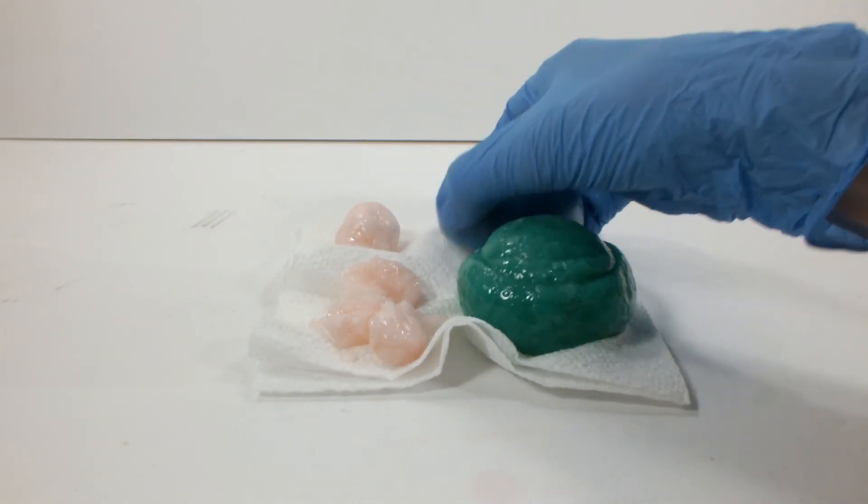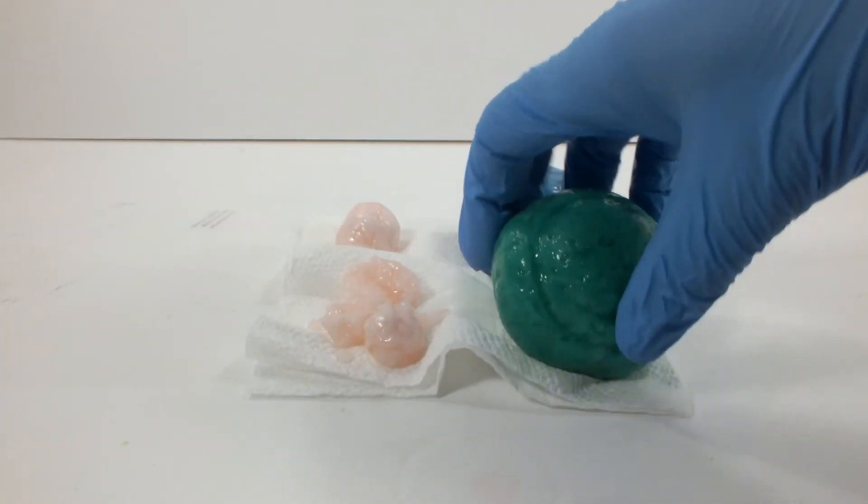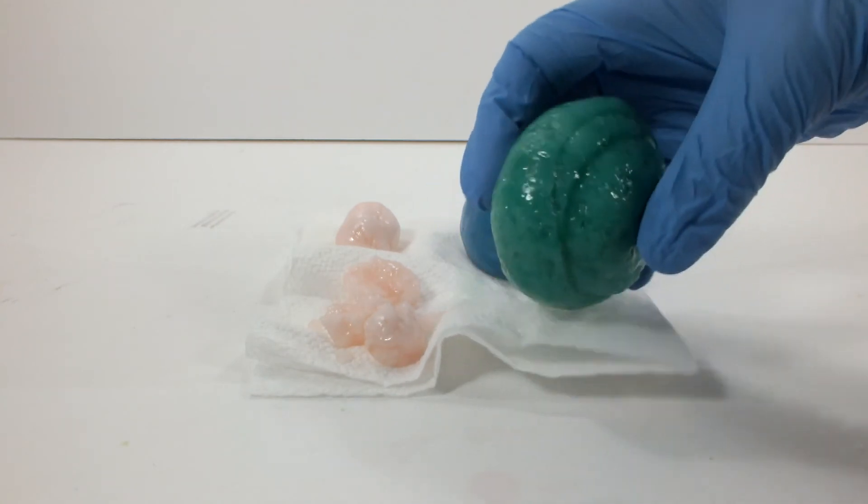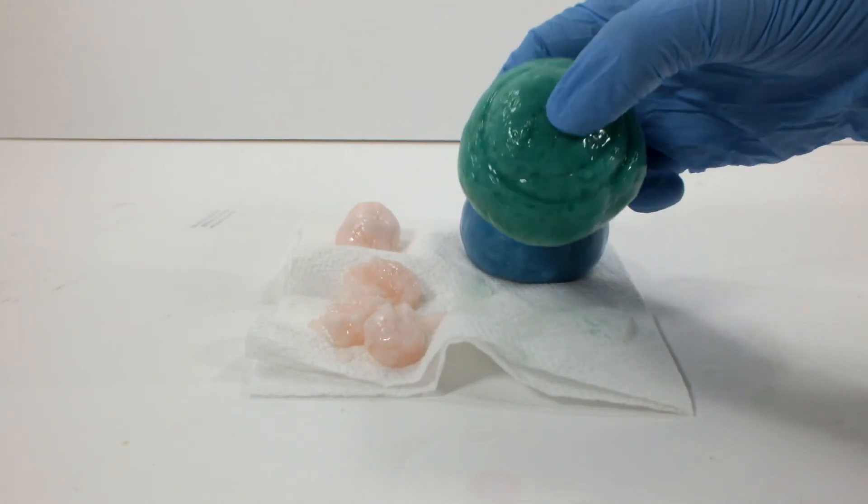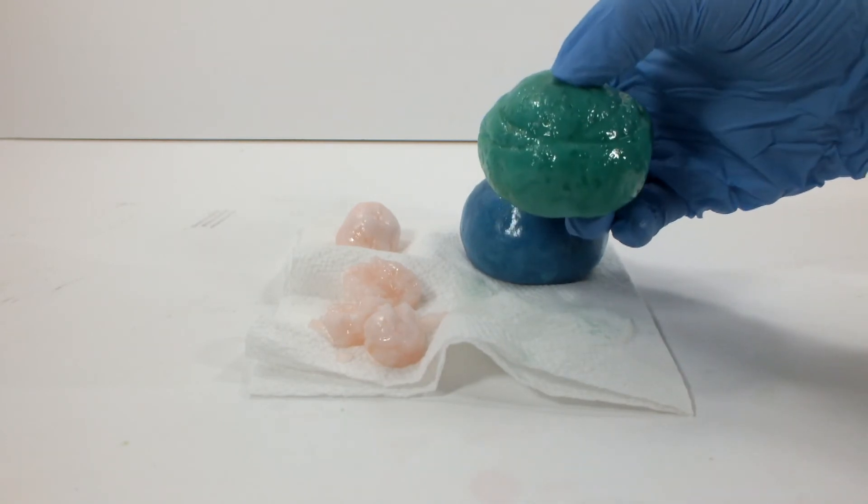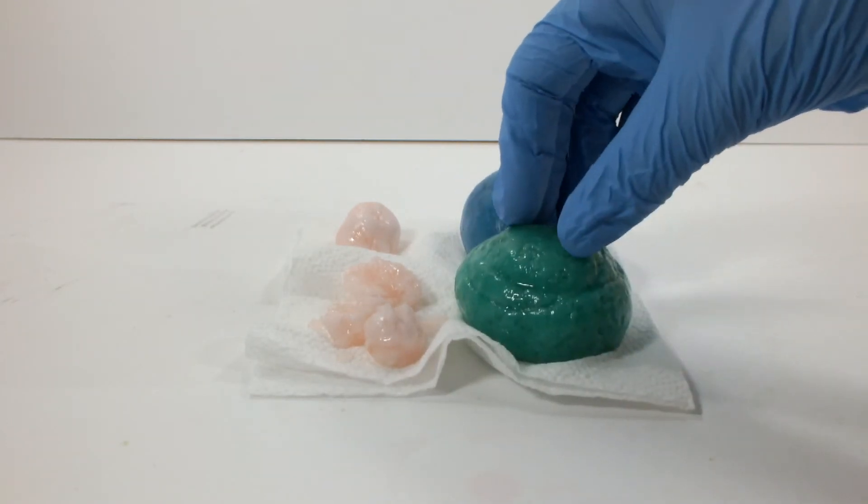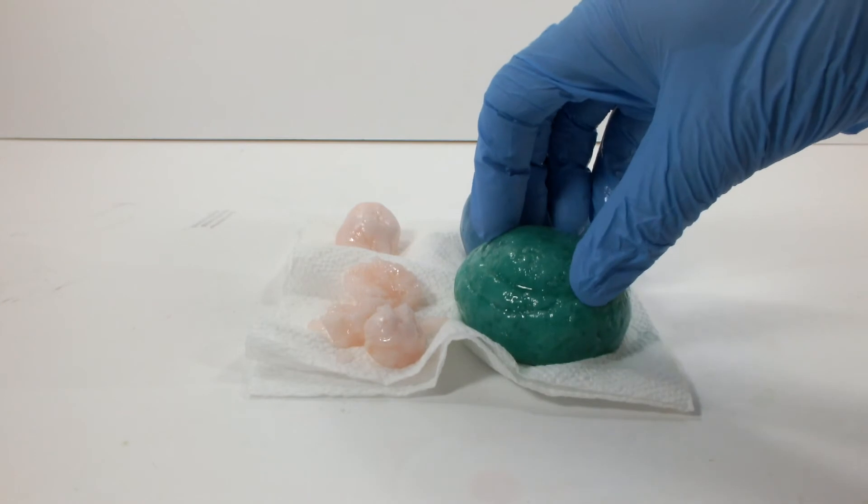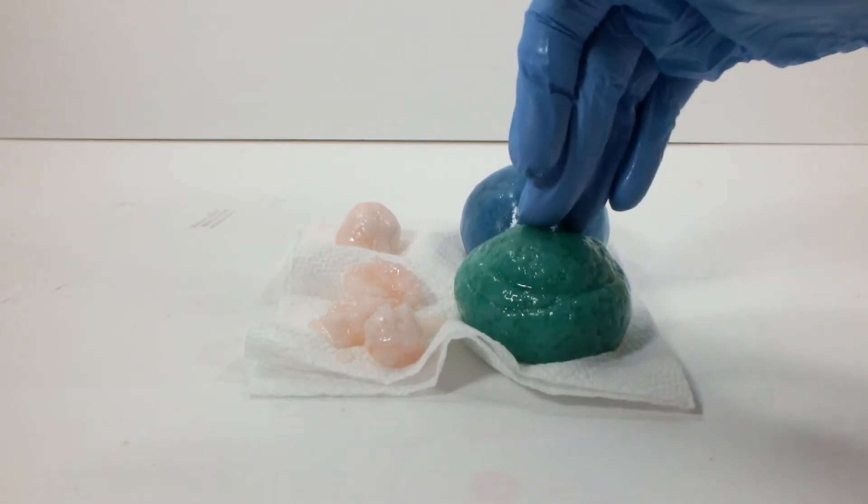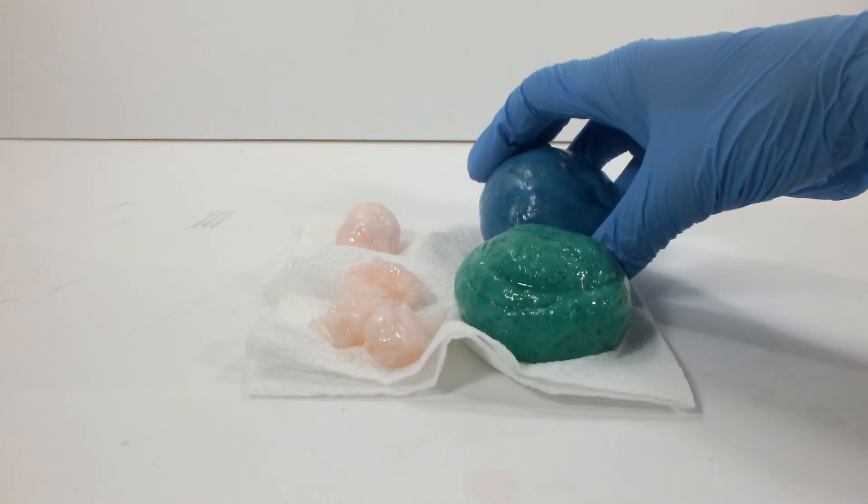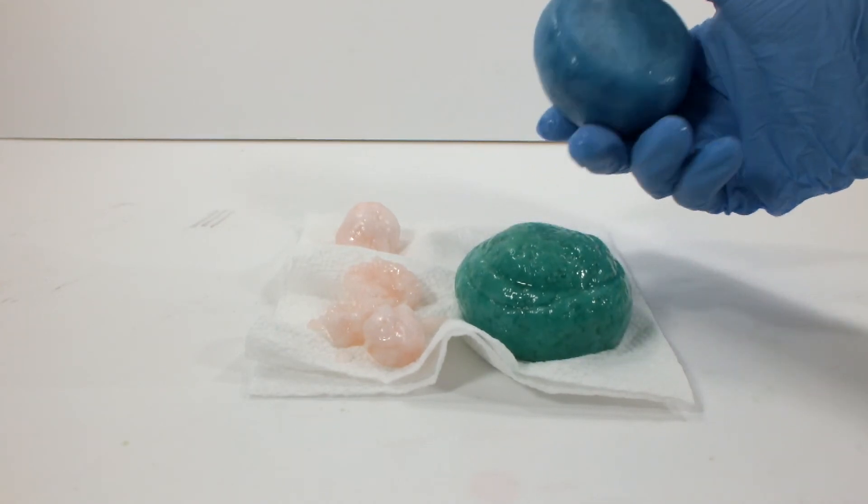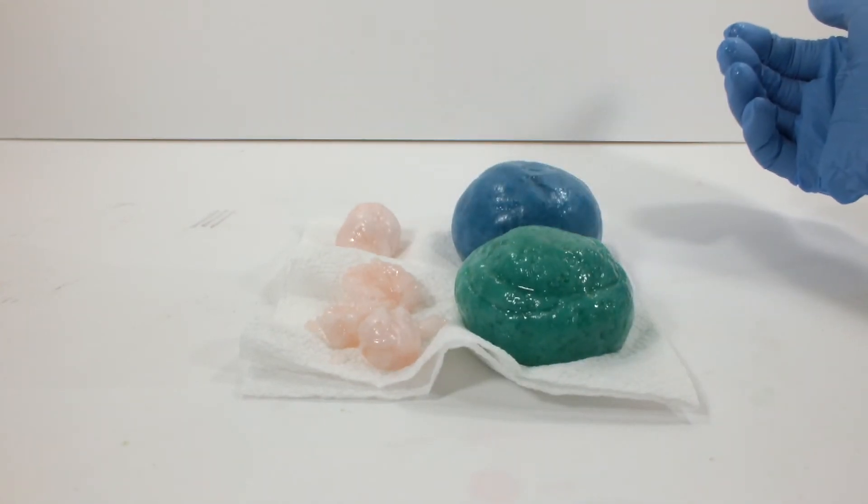And this one's especially sticky because it had the extra sodium silicate on it. I did, like I said, I did rinse it off in the sink. But you know, it's hard to recover from something like that. Anyway, that's that.